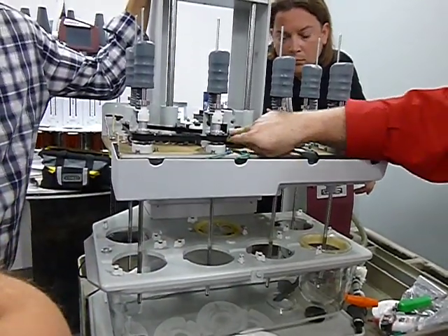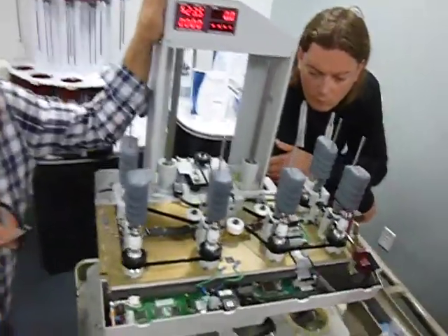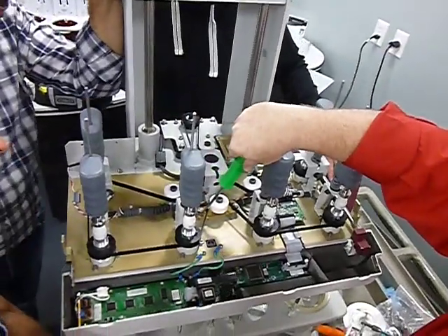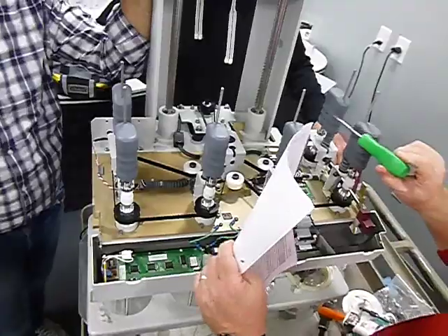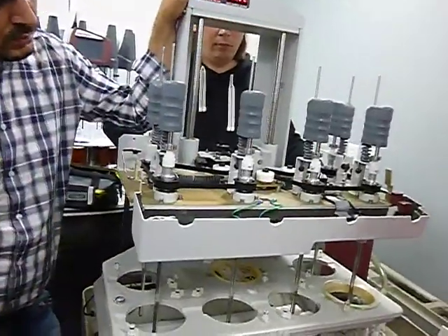No matter how much you keep on doing the tension. And another thing too is just to look and see how much play you still got. I still got a lot of space right here. See that gap right there? That means I still got lots of room to adjust that. If it's all the way that way, it's been adjusted about as tight as it's going to go. It's time to change the belt.